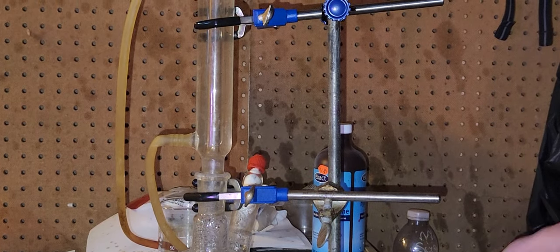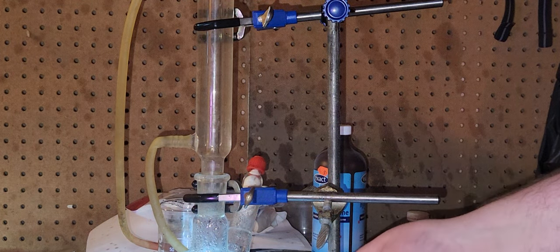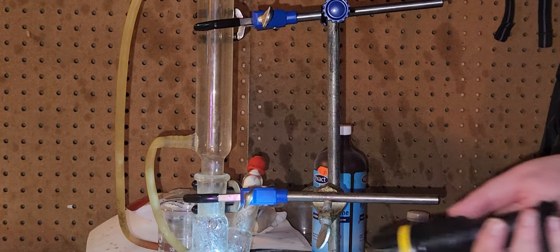I want to make lead acetate. The solution is cloudy, which is a really good sign because it means you have small particles of lead acetate in there.